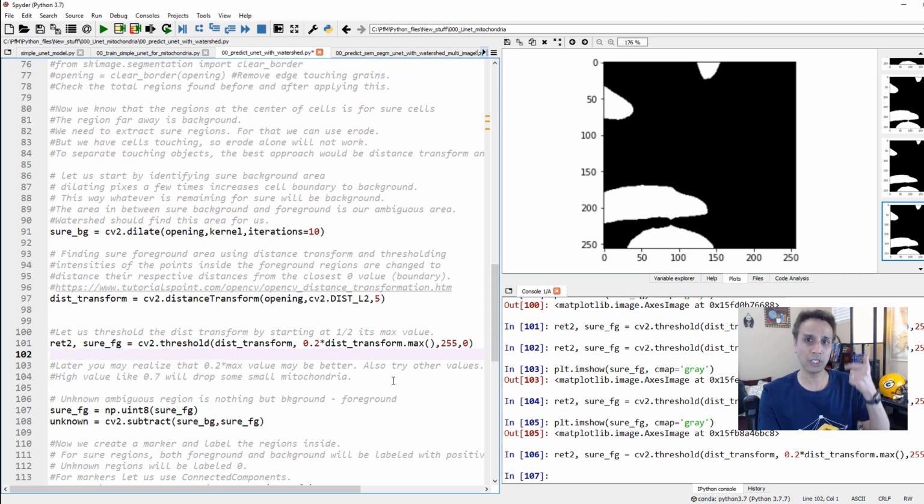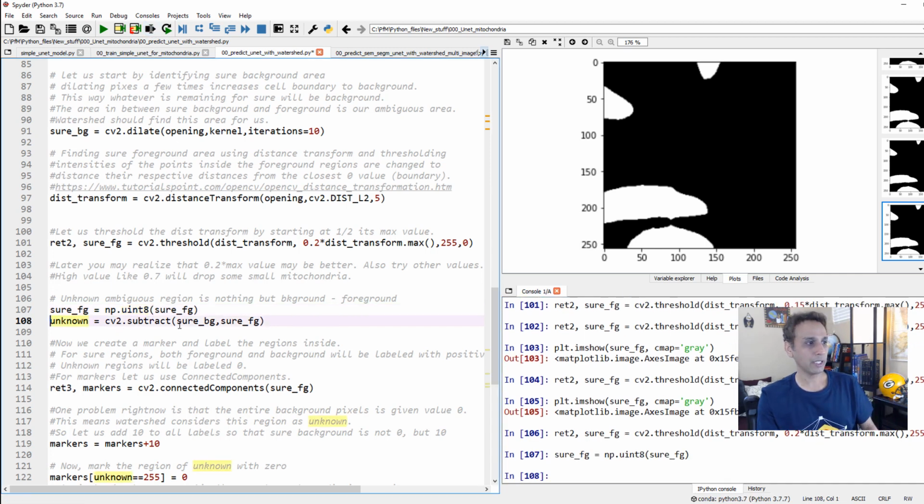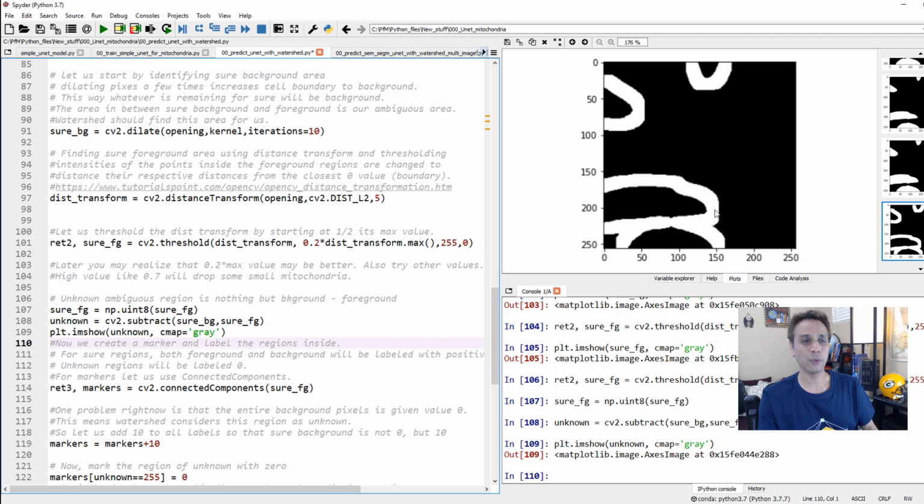Okay, we define sure background, we define sure foreground. What is the area where we don't know what's going on? It's just one minus the other, right? This is the area where we don't know anything. So that's exactly what we're trying to do here. Sure foreground, I'm changing this to 8-bit values. And my unknown is basically sure background minus sure foreground, right? Background minus foreground, these overlap pixels is my unknown area. So let's go ahead and do the math and plot unknown. Okay, so this, you see, these are the areas where I need help filling, where I need watershed's help. So I hope this makes sense.